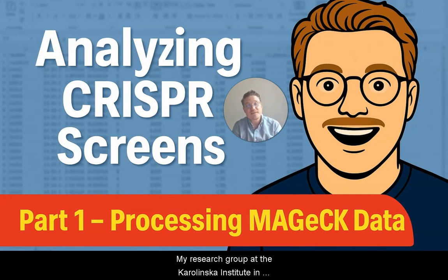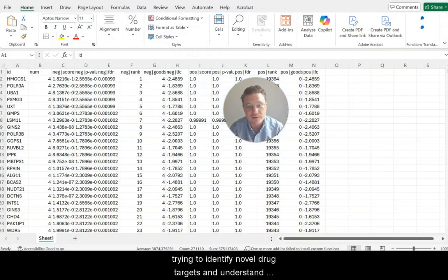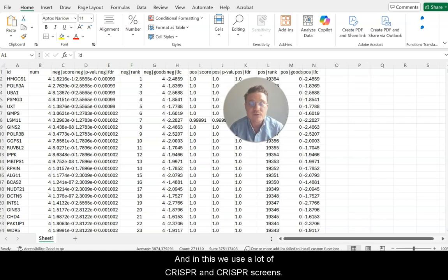My research group at the Karolinska Institute in Stockholm, Sweden studies cancer and autoimmunity, and we're trying to identify novel drug targets and understand biology that's relevant for these diseases. In this we use a lot of CRISPR and CRISPR screens. This is the first video in a set of videos where I'm going to show you how we approach analyzing CRISPR screen data.